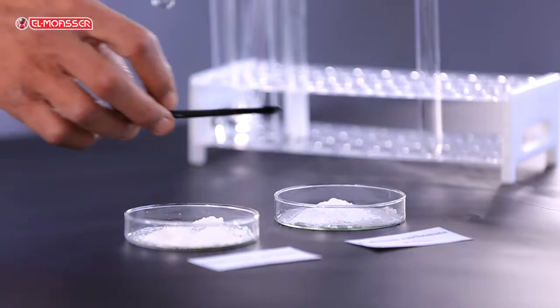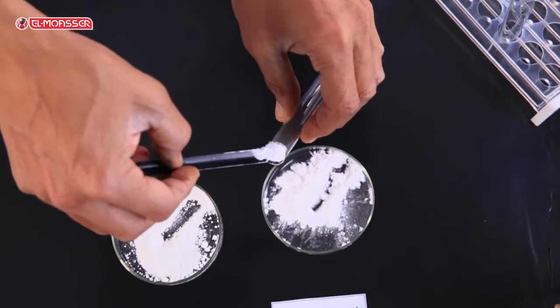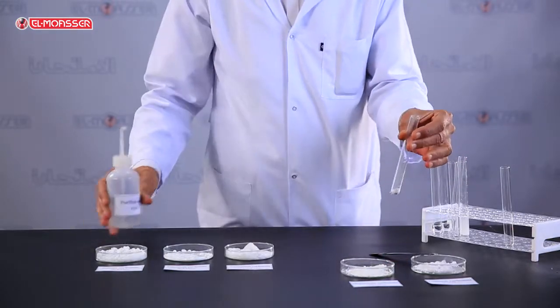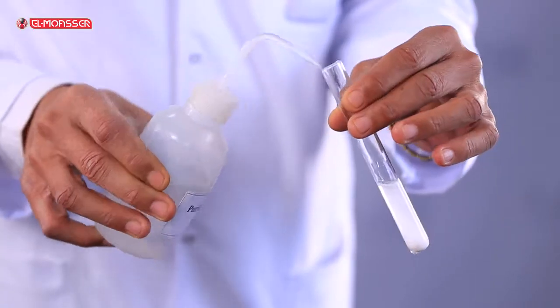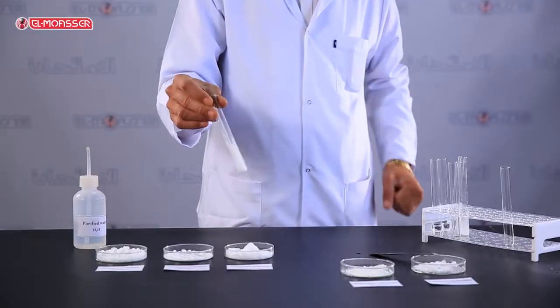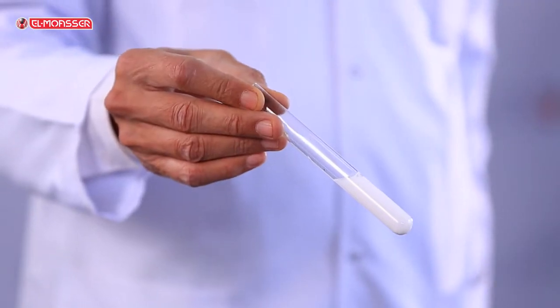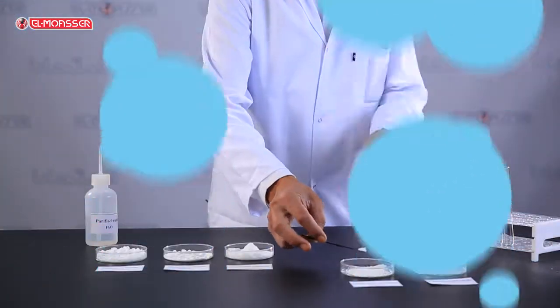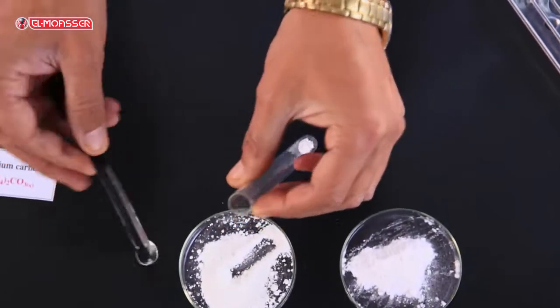On repeating the above step using calcium carbonate, you will observe that calcium carbonate is insoluble in water.